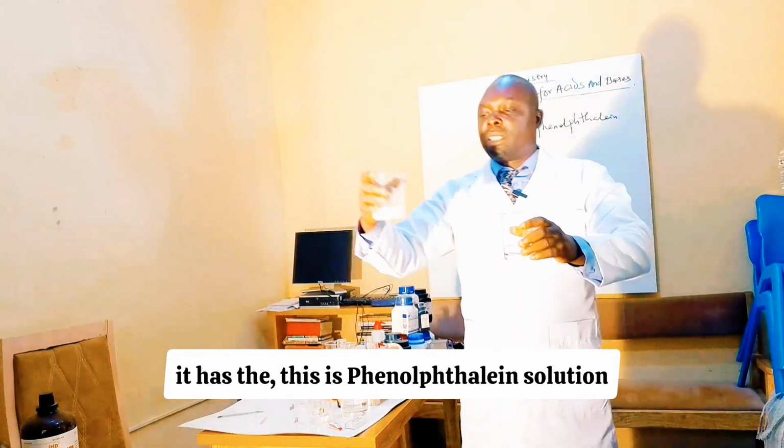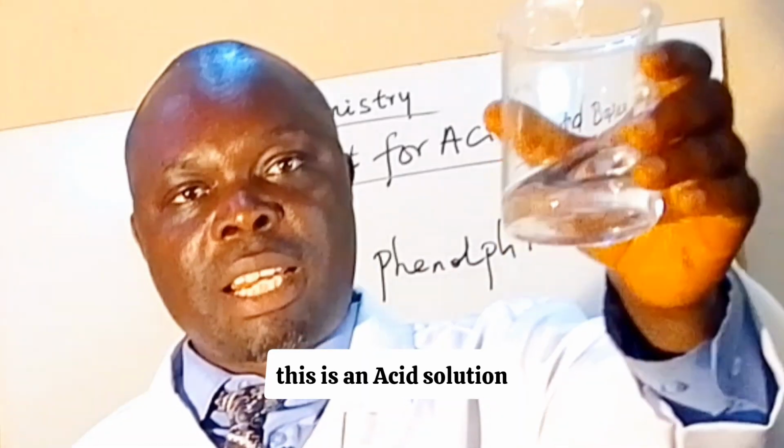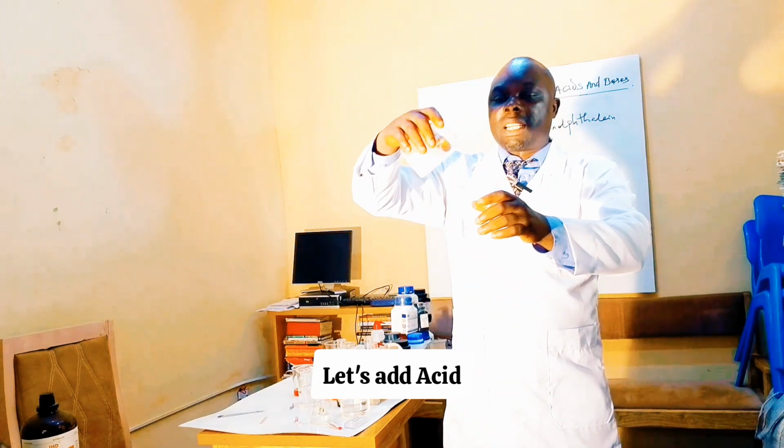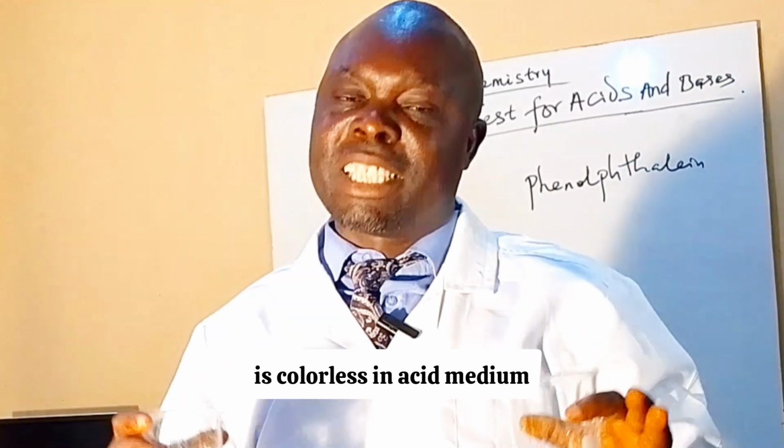This is phenolphthalein solution. This is an acid solution. Let's add acid. The phenolphthalein is colorless in acid medium.